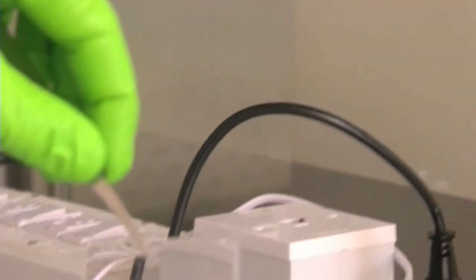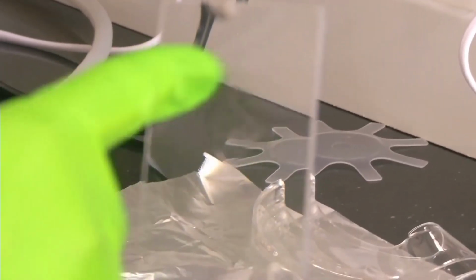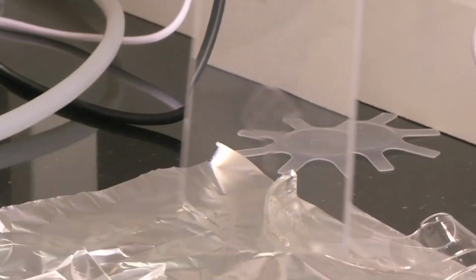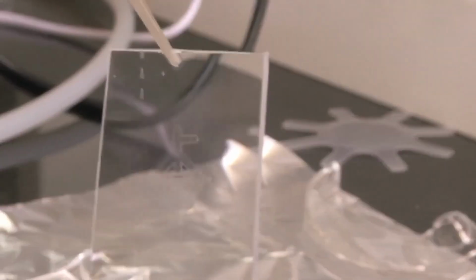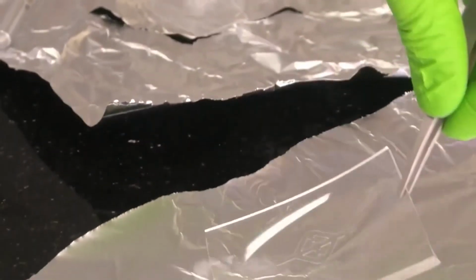So anyway, you might have seen the device. Yeah, you can see the device here. Now, yes, that is the device. So make sure that you don't contaminate it with air. So we have to quickly pack it off in aluminum foil and store it for use. So we'll put it in an aluminum foil and then we will store it for use.